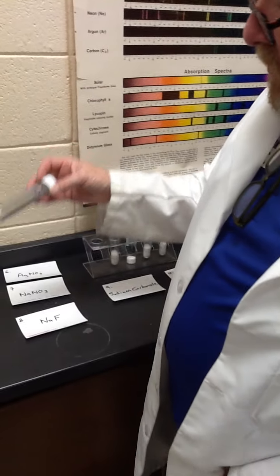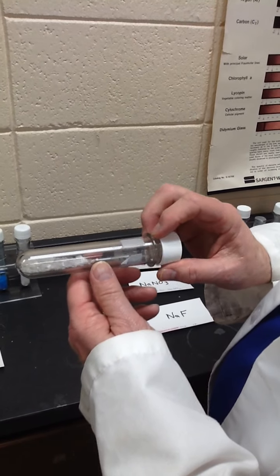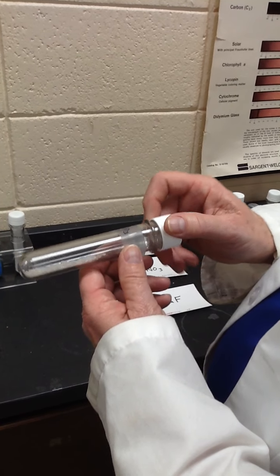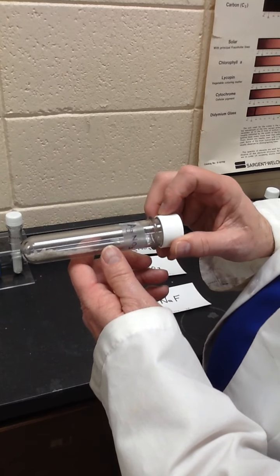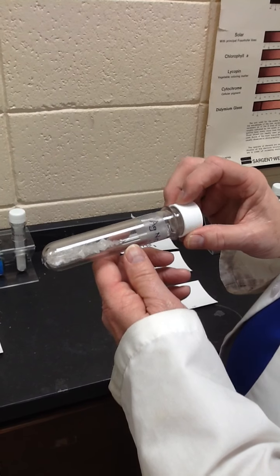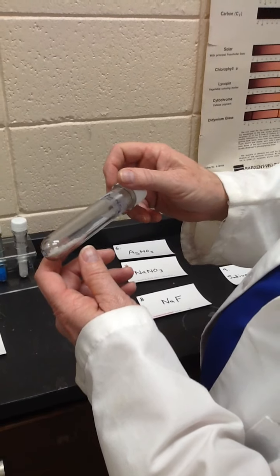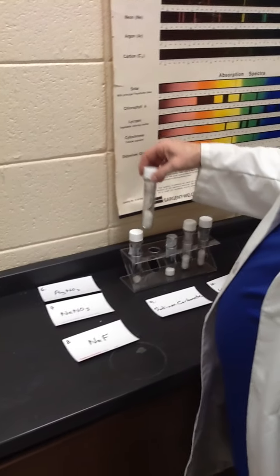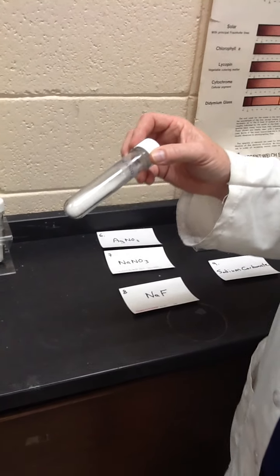The next one is AgNO3. These are gray, kind of flat, flaky crystals. You may notice I don't have a lot of it in here. You may remember Ag is silver. And so by mass, I think about half, I'll have to do the math to be sure, of this compound is silver, and it's expensive. So that's all I had in the bottle. And there is AgNO3.